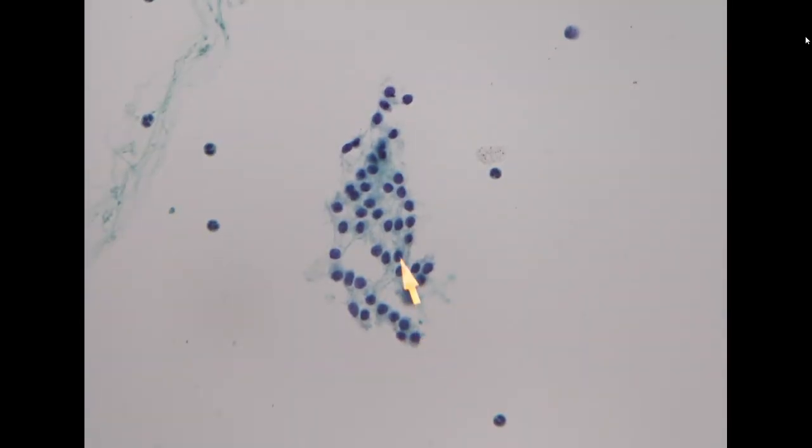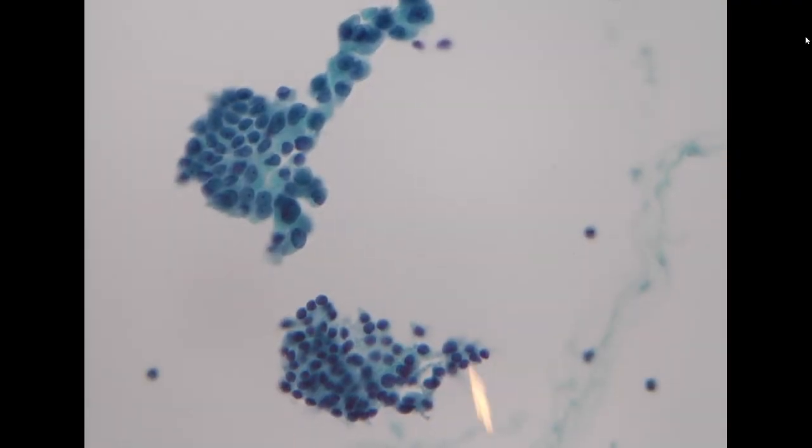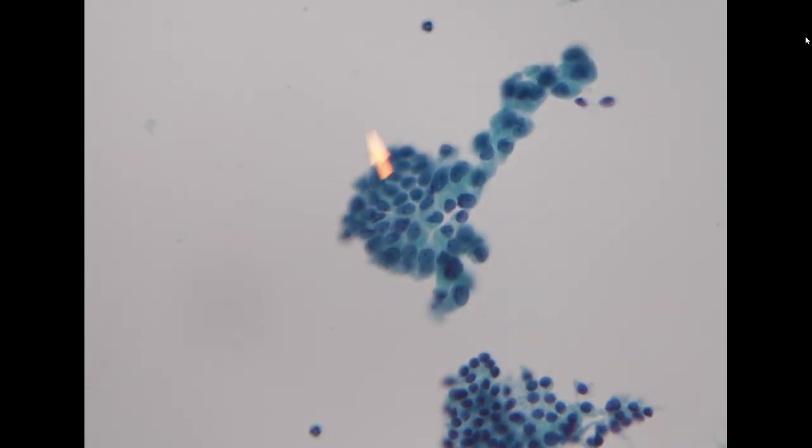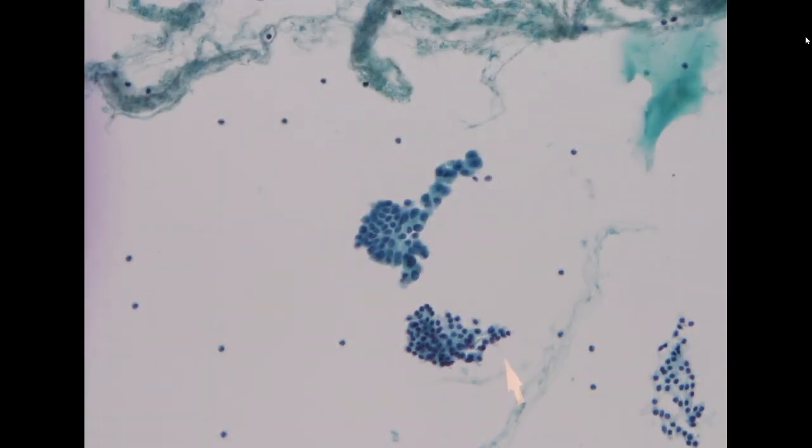But here you also see some benign-looking follicular cells. So this aspiration actually has a quite significant portion of benign follicular cells as well as a component of papillary thyroid carcinoma right adjacent to each other. So it gives you a very good contrast. But if you didn't screen the case thoroughly, if you only saw the benign one and didn't see the malignant one, you could probably call this benign.